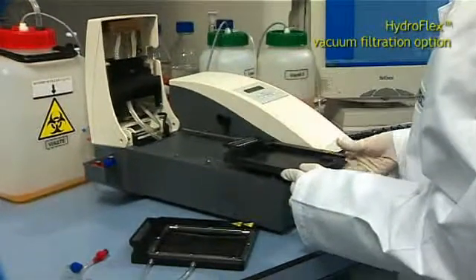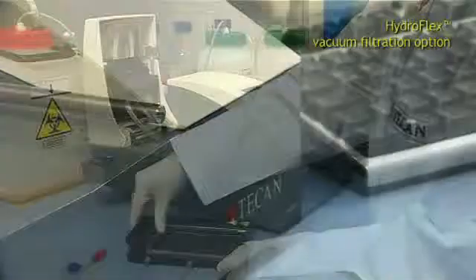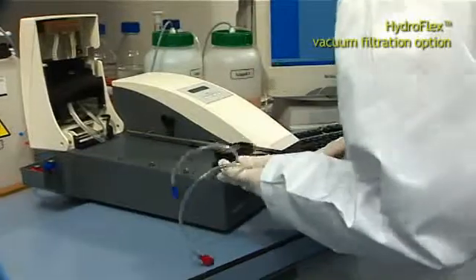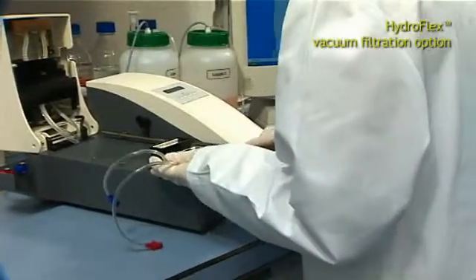A simple replacement of the standard plate carrier to the vacuum plate carrier is all that's needed to switch from standard applications to filtration protocols.